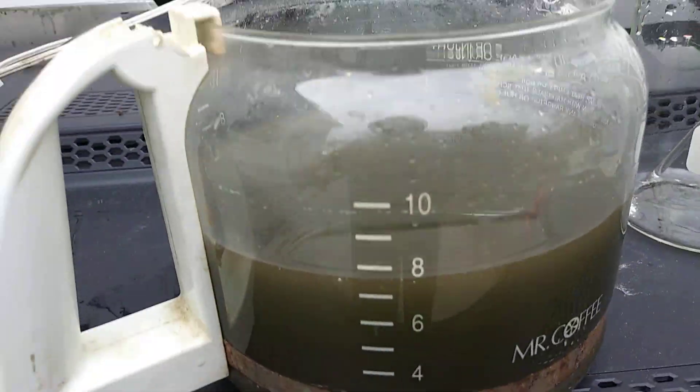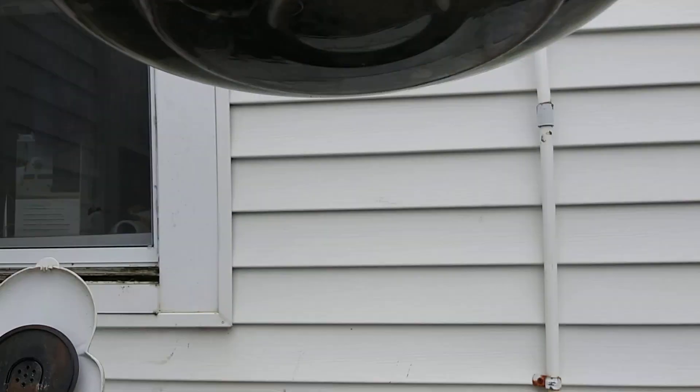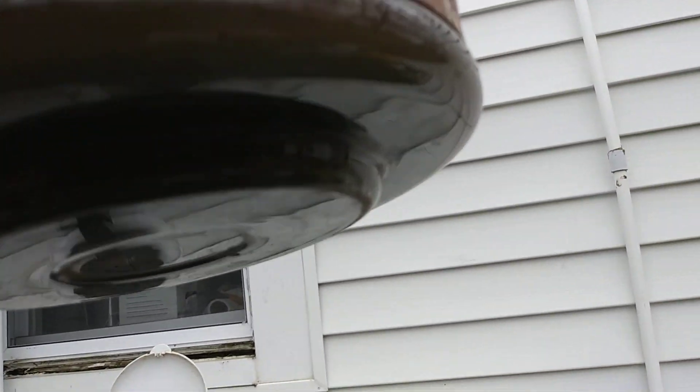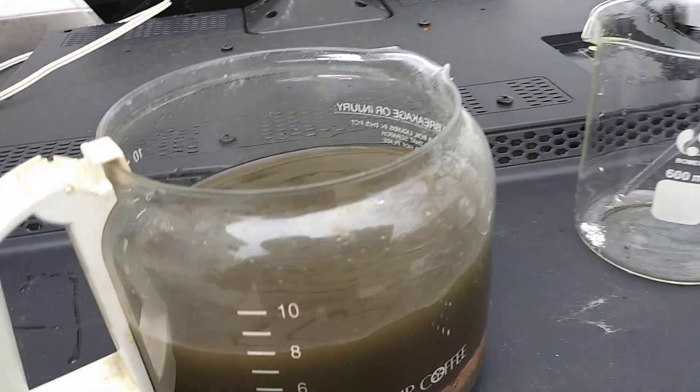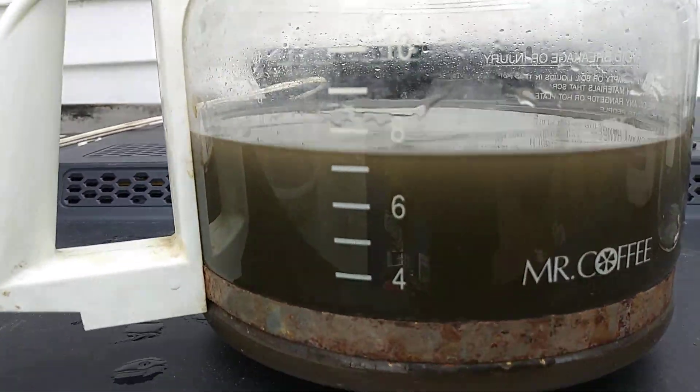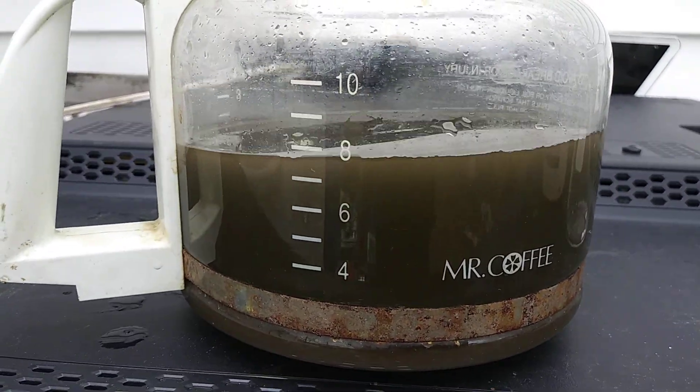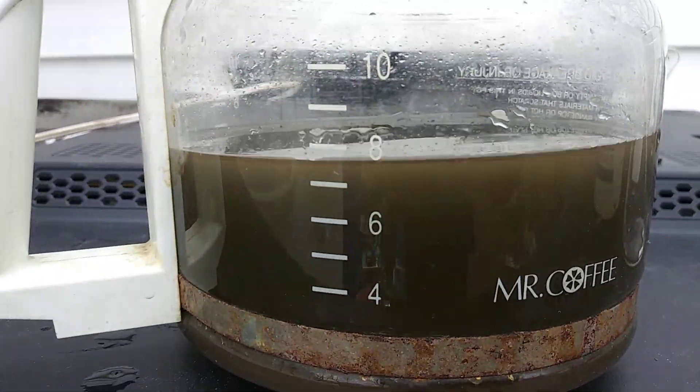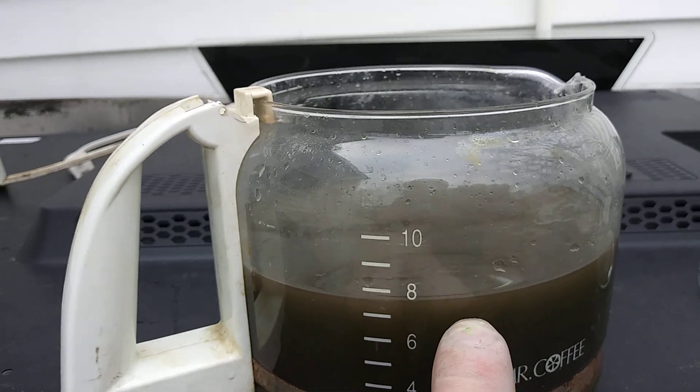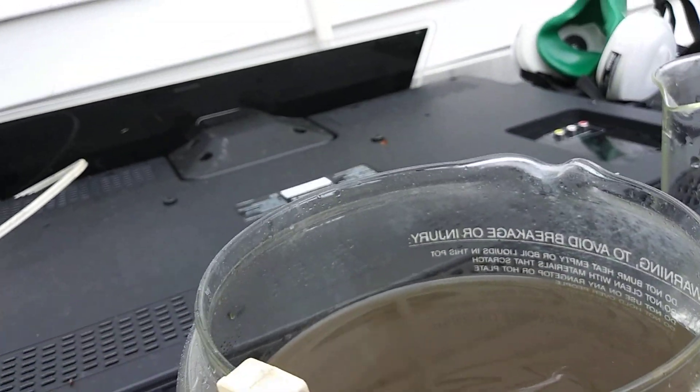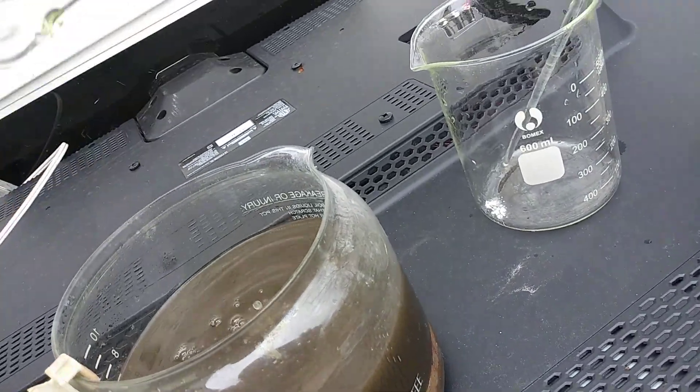So that's how that goes, guys. If you look on the bottom, I don't know if you can really see it yet. It'll just look like dirt. So like I said, all that brown that's in there will all settle to the bottom, and this top layer right here will be clear. And actually, I got a little bit more that came out of that filter, so we're gonna dump that in there as well.